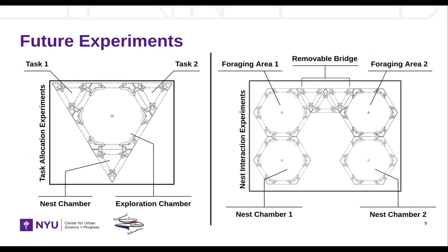The doors also do open to three-dimensional ant towers if needed, through the use of the threaded inserts as guide rails for stacking.